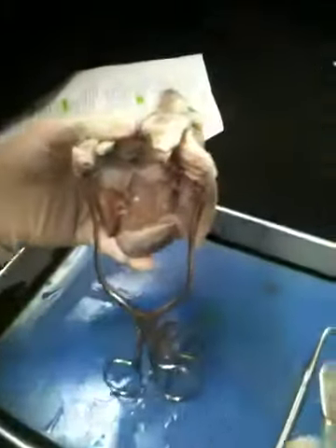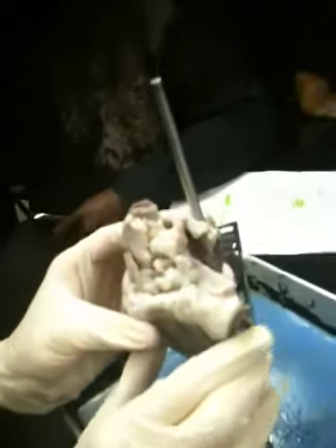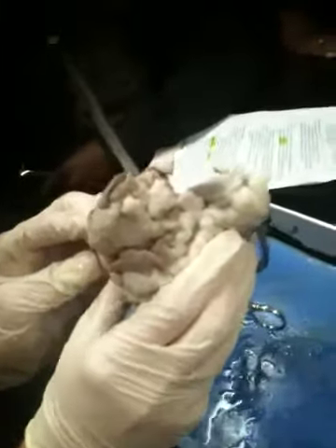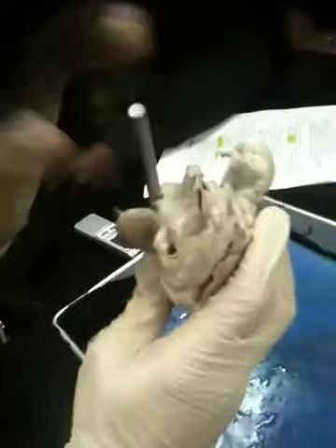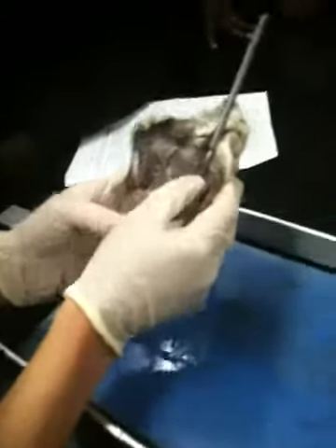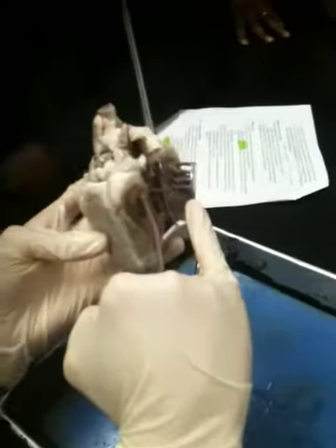Now notice a couple of things. One thing we want to point out is that over here to the side of the chamber, there's a little slip of muscle that right now is passing over the probe. This is one of those structures that was not really shown in any of the models thus far, but now there it is. Exactly, the moderator band. It almost looks like a little rubber band literally right now passing over the surface of that probe. I'm using the probe to lift on it. And so sure enough, that little slip of muscle passing over the surface of that probe is the moderator band. And that's in the right atrium?